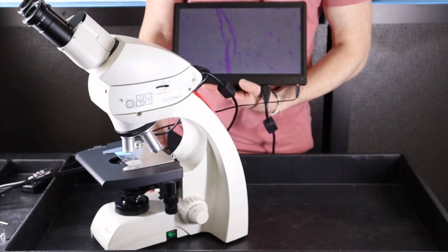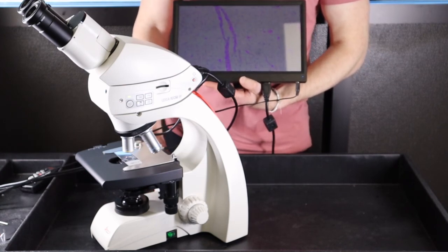And that's how you get started with the ICC50W camera in HDMI mode.